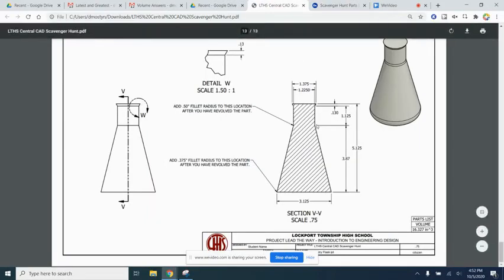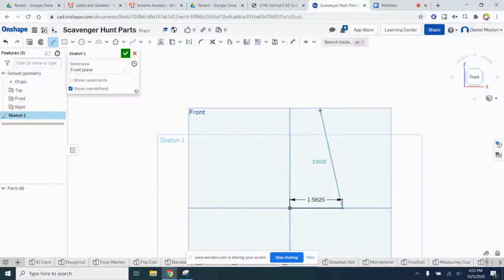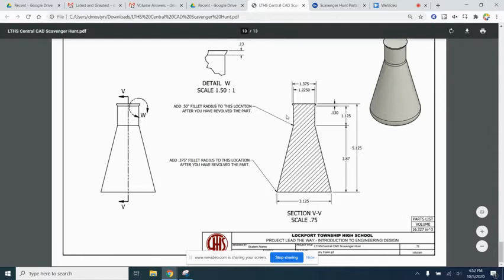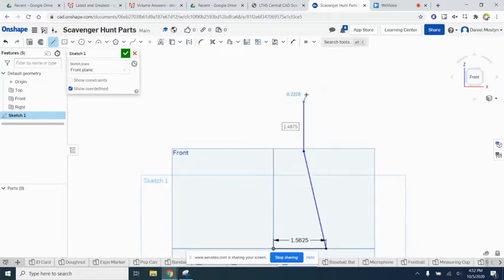All right, the next step is to come up to this little point right here. So we'll go like that, and then straight up, and then we'll do this little lip right here. Don't worry too much about the dimensions at this point. We'll put them in a second. Let's make sure we're going straight, and you see how we hit the axis? That's why we started at the axis, so we can have a little guideline for us.